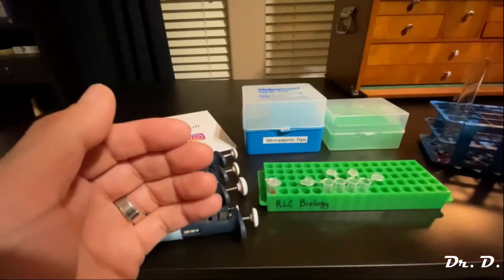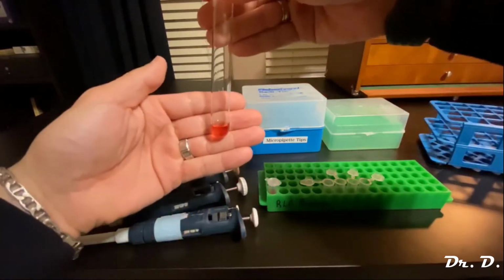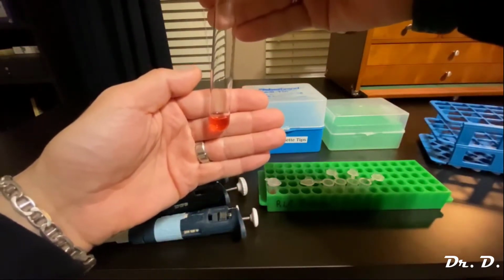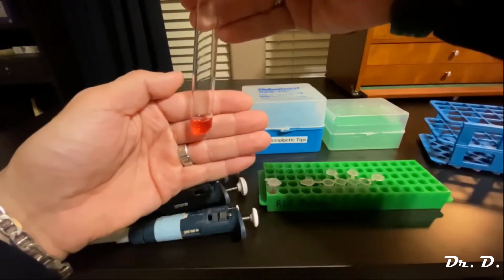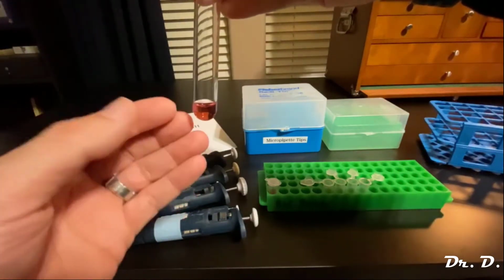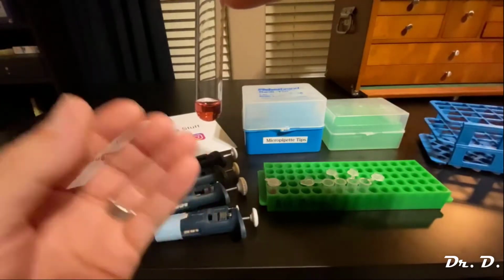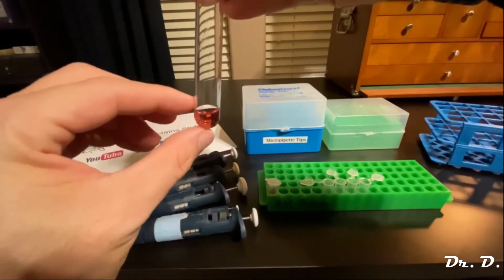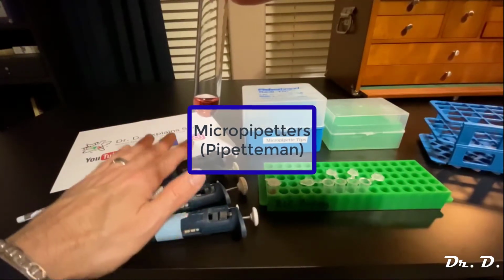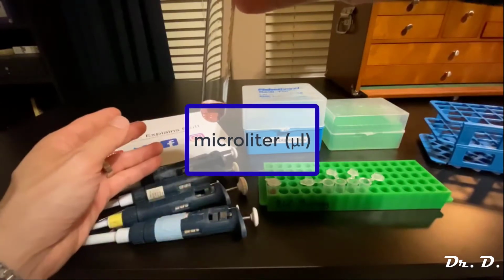If you're working with this amount, this is a milliliter, right? Or less. A lot of times, especially in molecular biology labs, biochemistry labs, you're dealing with this much solution or less, sometimes a lot less than this. So what do you do if you've got less than a milliliter to deal with? In that case, you're going to want to use micropipetters, which are designed to work in the microliter range. So what's a microliter?